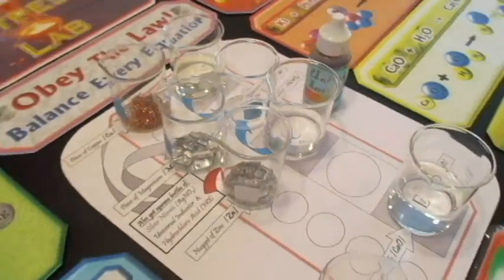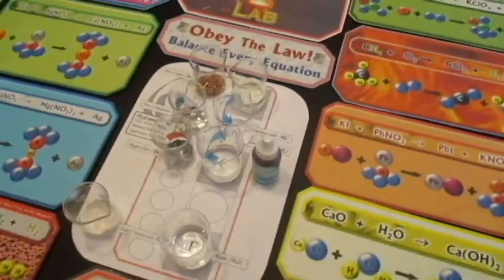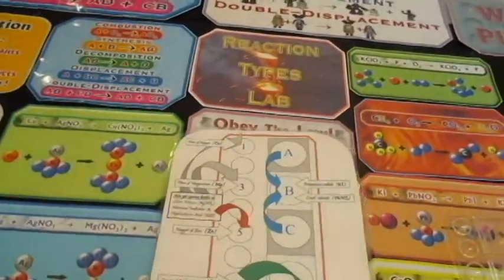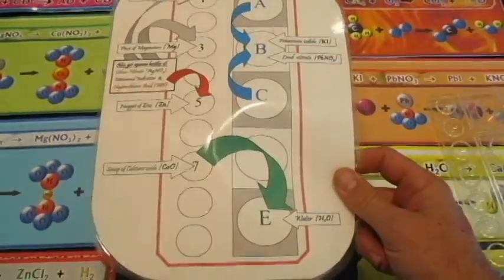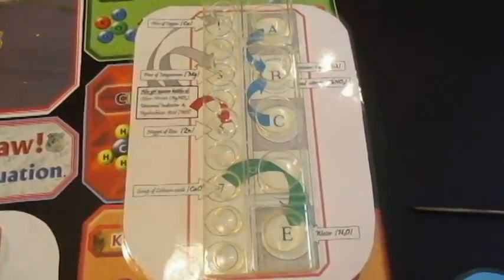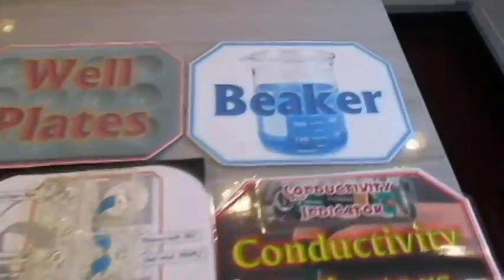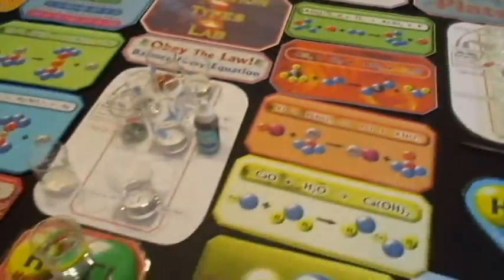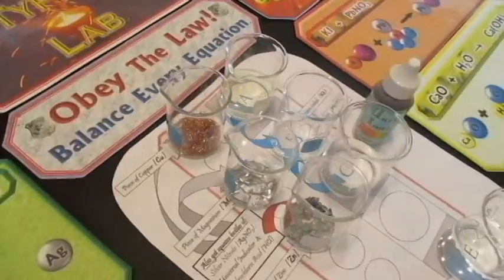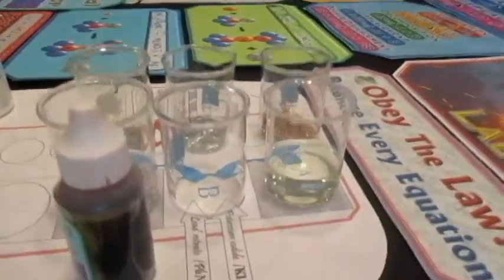So we're going to have really big reactions here. Normally we do this in a well plate. So this placard was actually designed for a well plate. Notice, this is designed for this particular well plate. Fits right on top of it. So because we're doing it instead in beakers, we are going to get big reactions, much bigger than we would normally get in our lab room. So this is one for the video. This is one that you can see on camera.